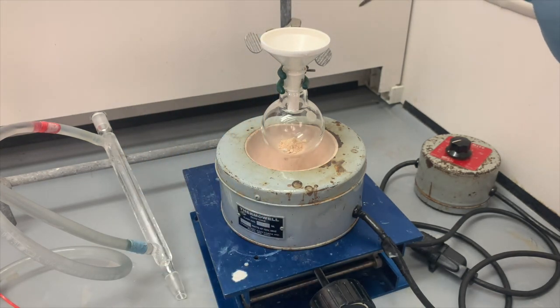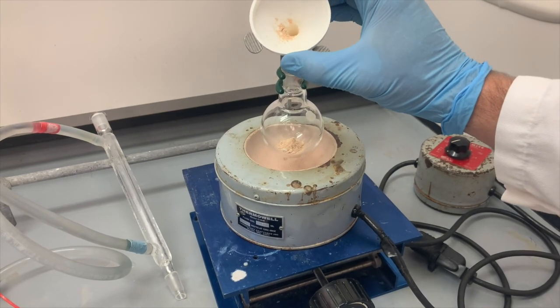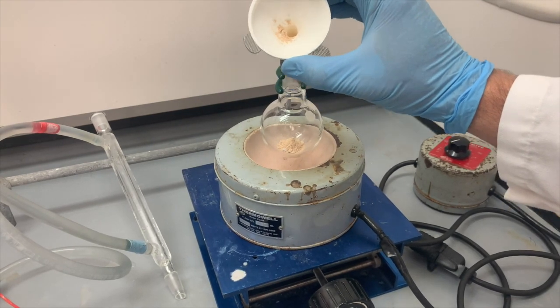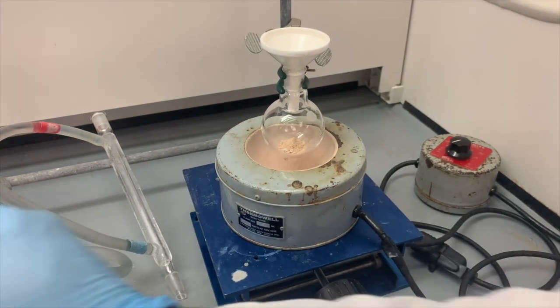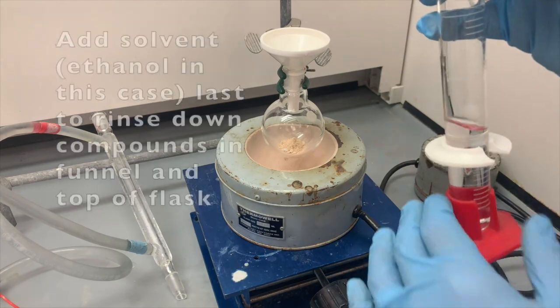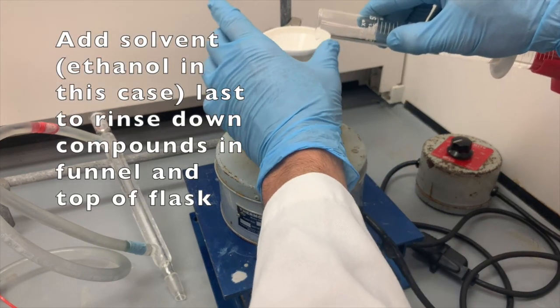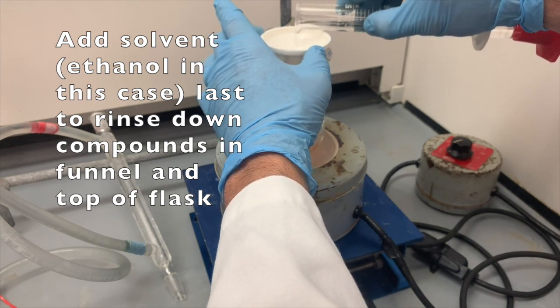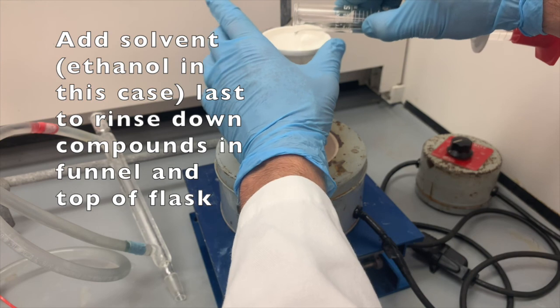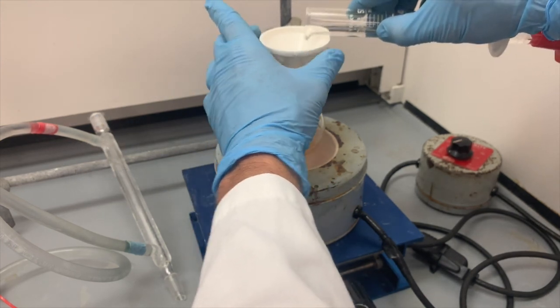Okay, there you have it. So if you take a look at our funnel here, there's still a lot of our compound, our reactant, that we want to make sure gets into that flask. So we're going to rinse as we add our solvent. It's always good to add your solvent last. We can rinse down the sides of this funnel to rinse all of the materials down into our round bottom flask.